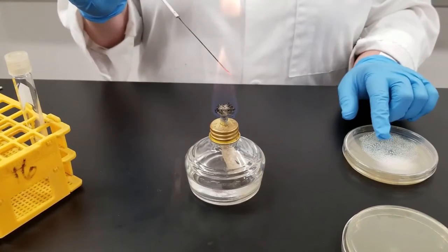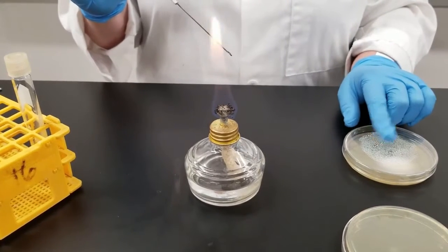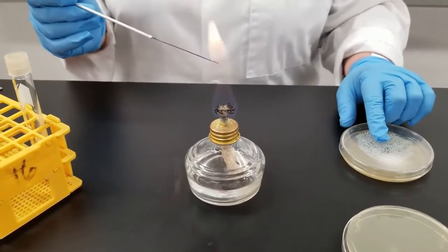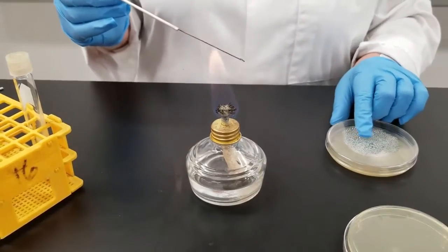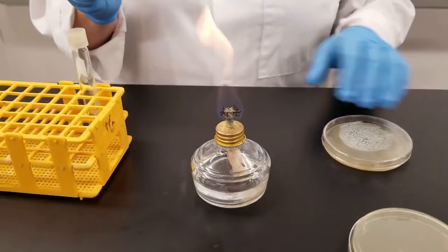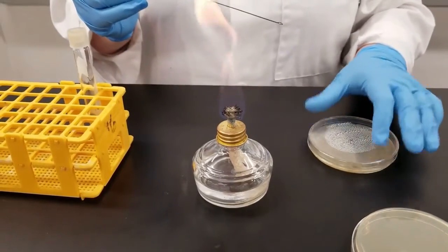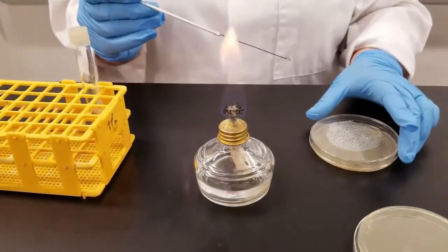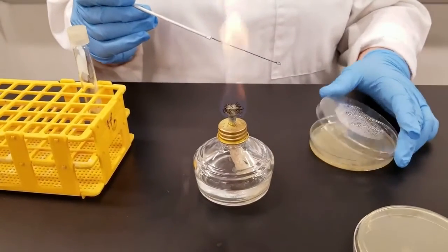The reason for that is because you can see on this plate that has been stored, we store it in the fridge after 24 hours, you get condensation on it. When you are trying to grow cultures, that condensation will mess up trying to get individual colonies. So we always invert them.